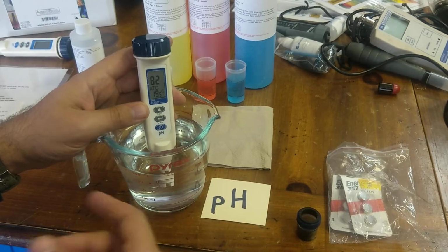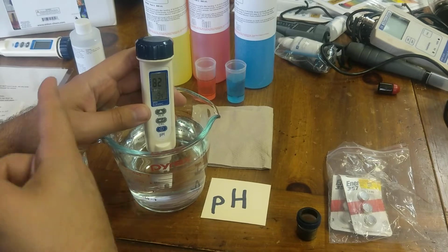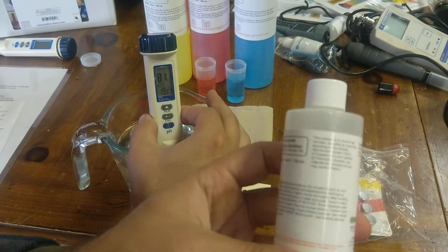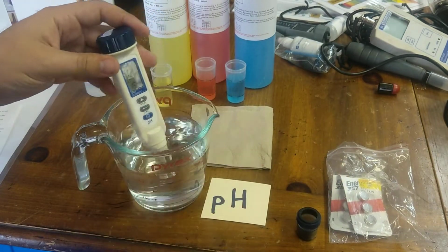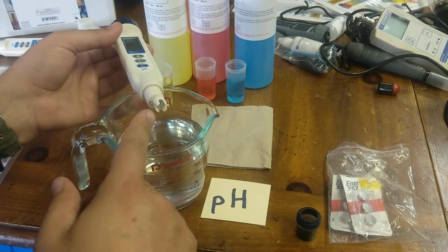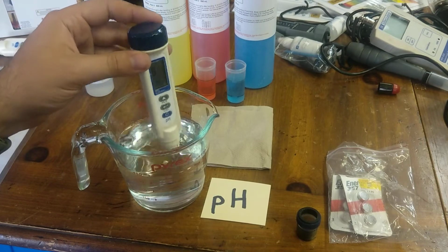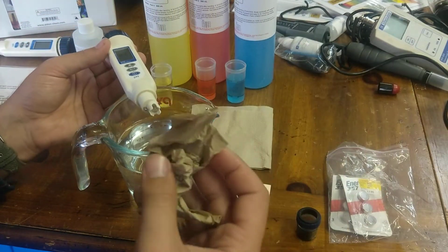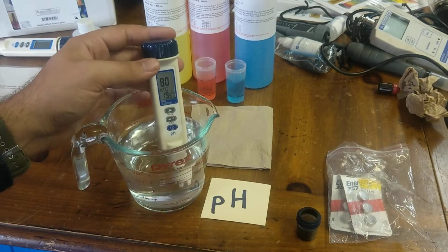You can also soak them in water for like 5-10ish minutes. If they've been in long-term storage, it's best to soak them in this first. And then you'll want to rinse them off in some water afterwards. There may be some salt buildup in and around the bulb area. You'll want to just rinse that out. Again, do not touch the bulb or scrub it with anything, because that will damage the bulb.